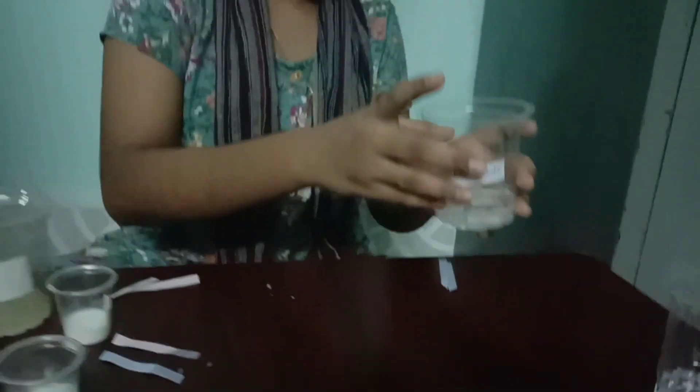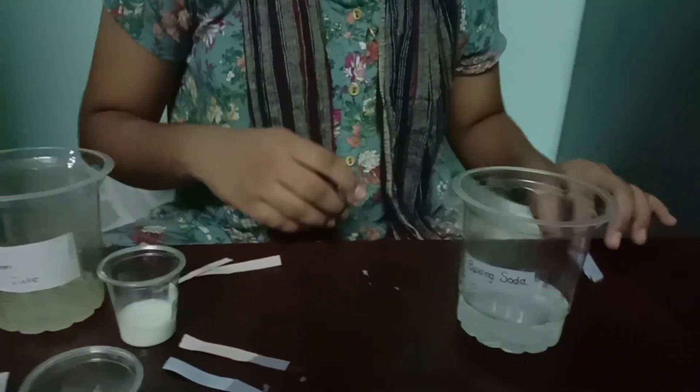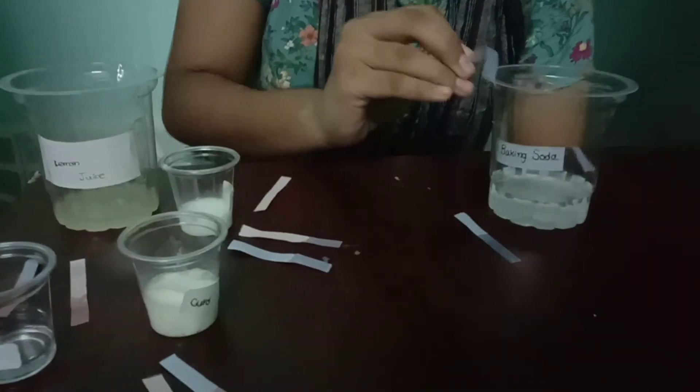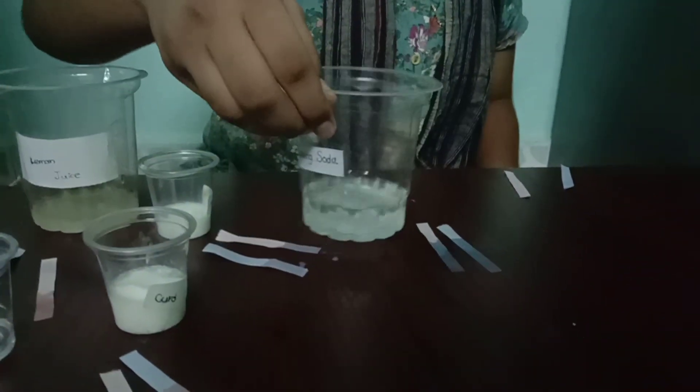Now for baking soda, it turns from red litmus to blue litmus. So it is a base. Baking soda is basic in nature.